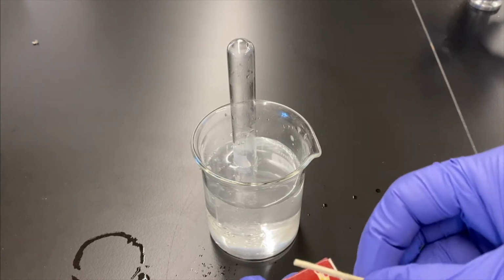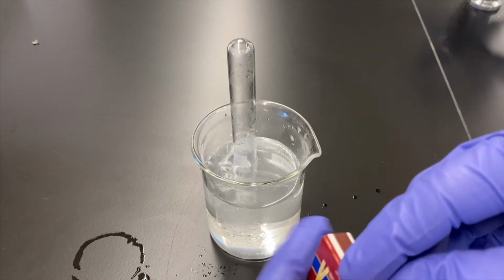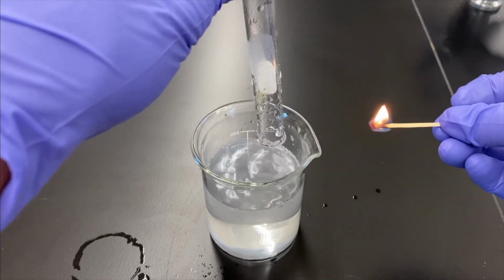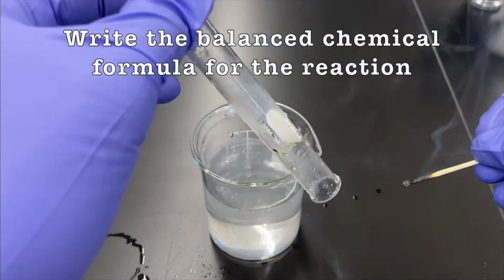All right, so we sped past some of that. Now we've collected a tube full of gas, and we're going to see, again, using our good friend fire, if we get a combustion, then yes, we formed hydrogen gas. There it is. And you can see that kind of caught me off guard.